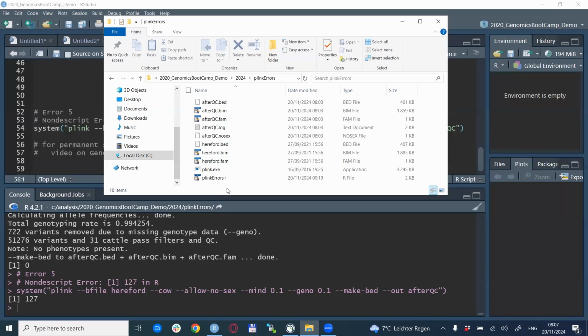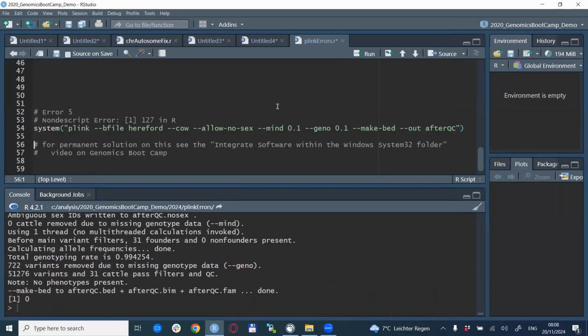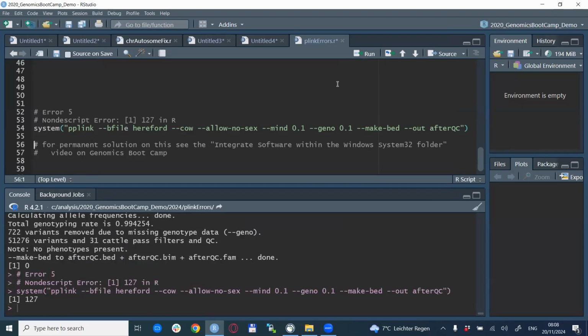Now I moved the PLINK exe back, so you see it's back in the folder. When we run this now, it should work correctly. The same thing happens again if you have a typo in the executable file name. Here I put in a little typo, and this does the same. So again, there are two things to check: either if the executable file is really in the directory you are looking for it, or if it has any typo in the name in your R script. That might fix this issue.